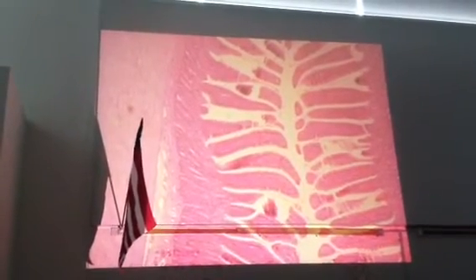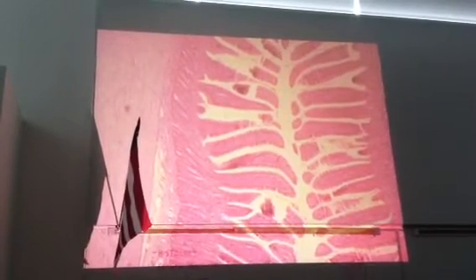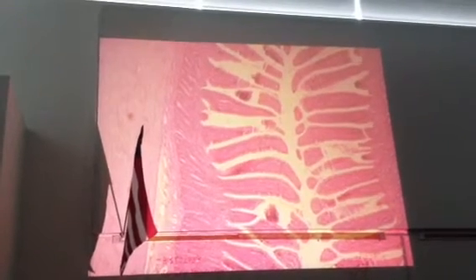So we see villi, we know we're in the small intestine, and our next question is, where are we? So let's think about what the villi look like. If they're spiky, we're in the duodenum. They're not very well developed. And then we would look at the second tunic, because this is the tunica mucosa. We look at the second tunic, the submucosa, and ask if there are Brunner's glands there. And they're everywhere, so you don't have to look around very hard for them.